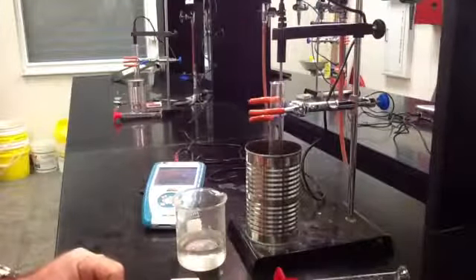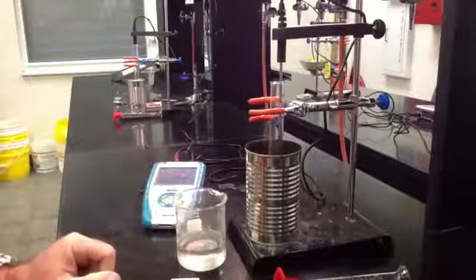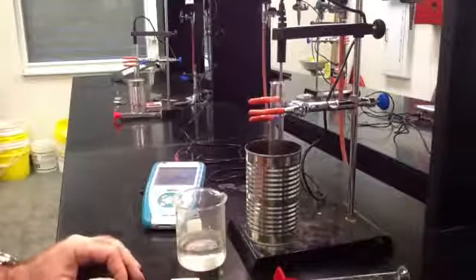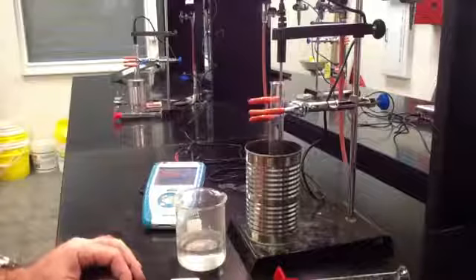completely burns out - that will be your final temperature. After you've done that, just clean up your lab. That's all there is to it.